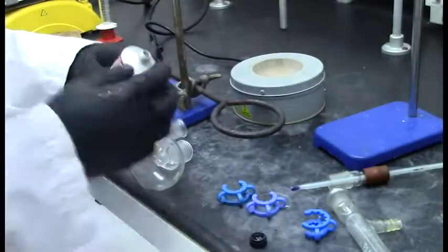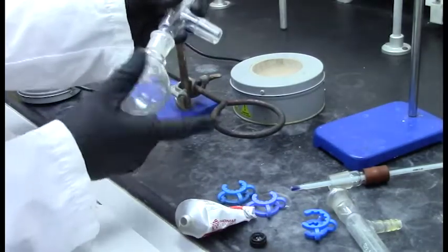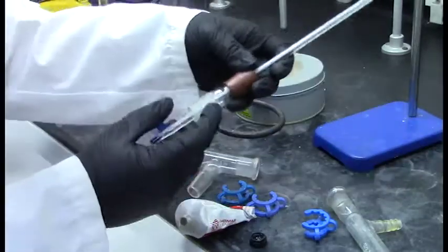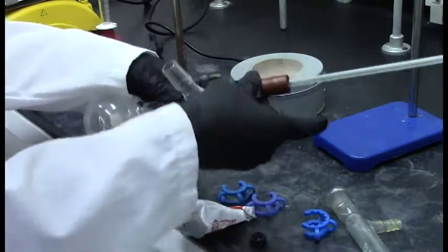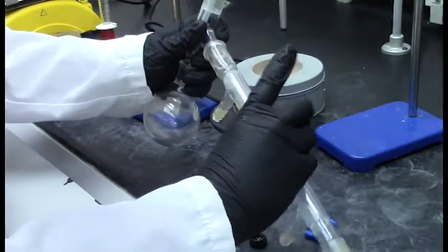It is crucial to grease the joints. Using a minimum amount of grease, add to each male joint, insert into the accepting port, and rotate gently. This will allow for optimal lubrication with minimal contamination. Greasing is required to prevent the joints from sticking together and potentially breaking.